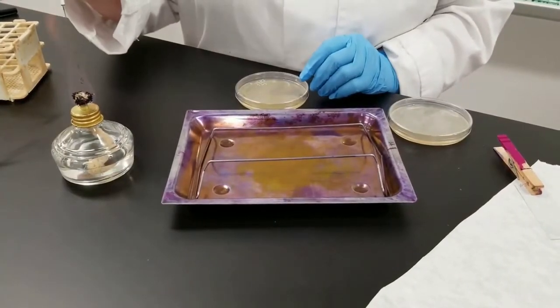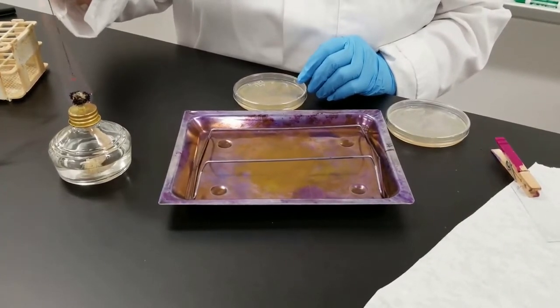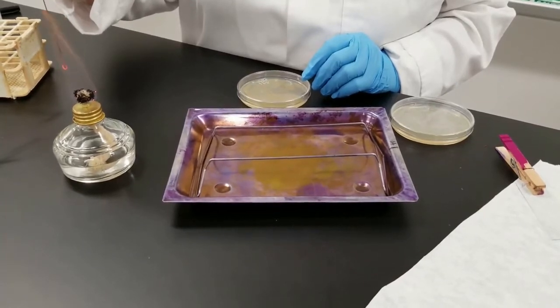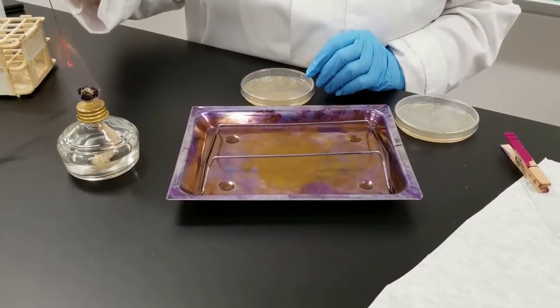Okay, so what we're going to do now is a Gram stain, a differential stain. It uses two different dyes. That's why we call it differential. You can distinguish between different bacteria.